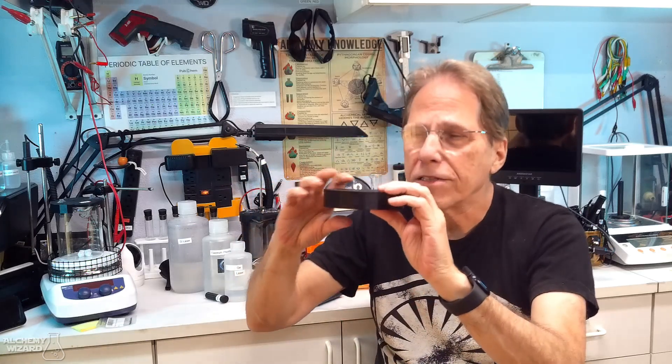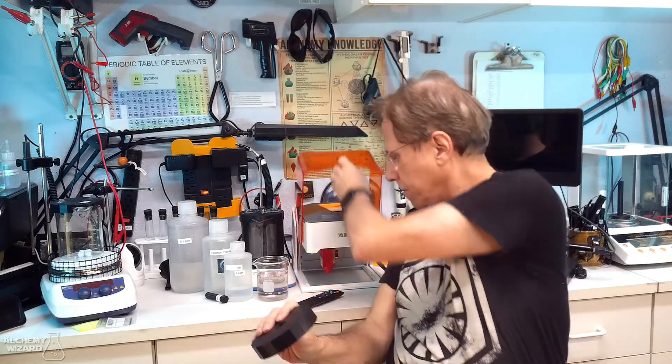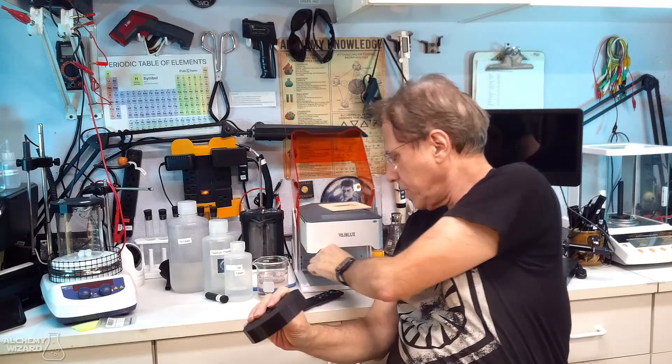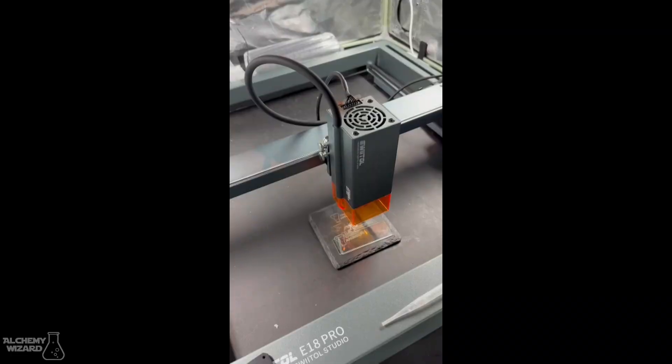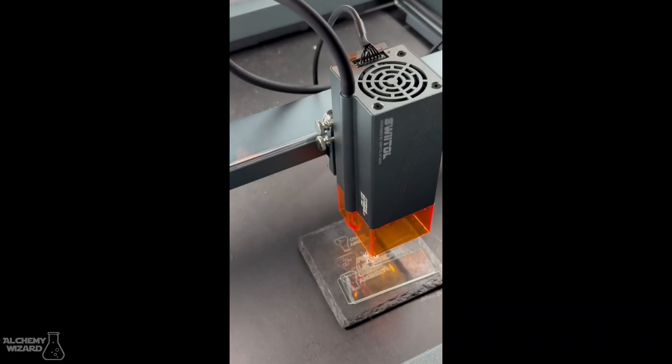Now the other thing that is nice about this and covering the sample with the petri dish cover, wasn't a problem with the 5 watt laser because the 5 watt laser, the laser is hard connected to the top of this thing. But on the 18 watt laser there's these two little tiny thumb screws that hold the laser up and down at the proper height.